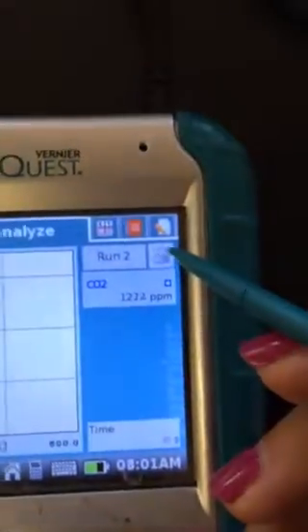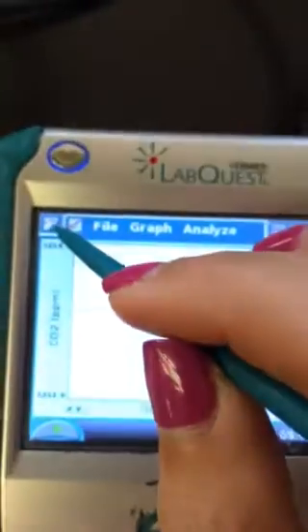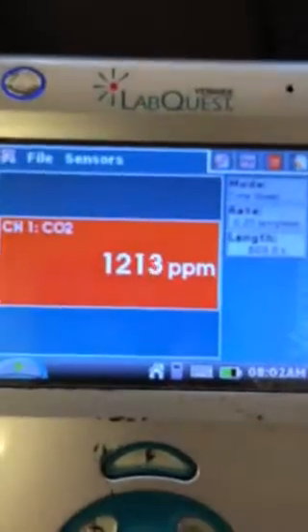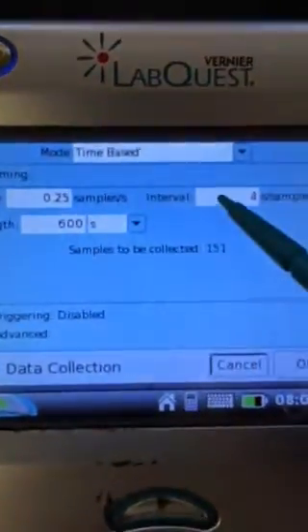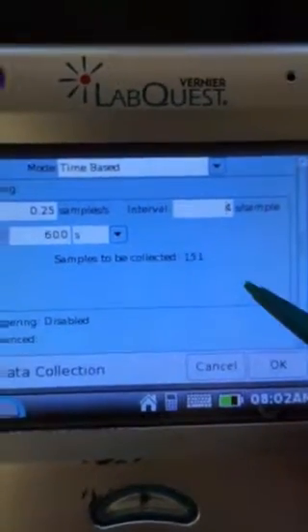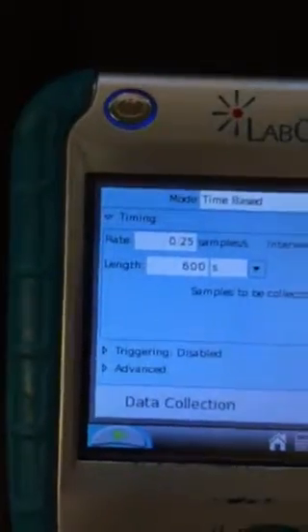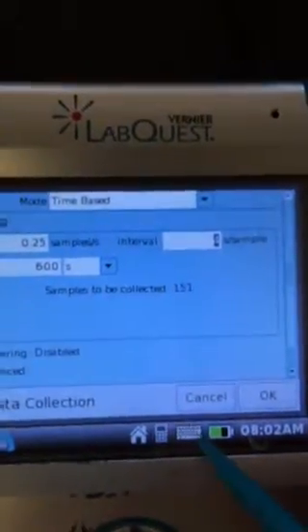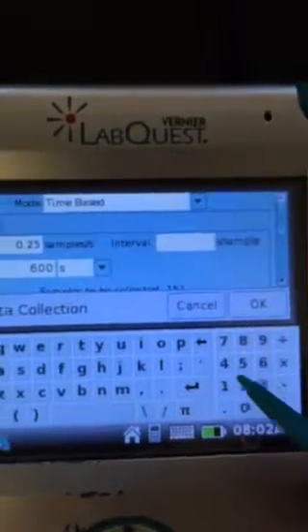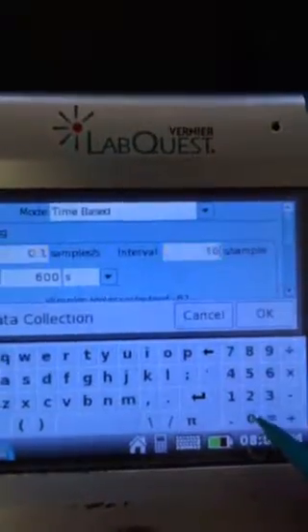So let's delete or just start a new run. I pressed this button to start a brand new run. If we go back to the main screen by hitting the top left corner and click right here, it'll allow us to change those intervals to whatever we want. For example, instead of every 4 seconds for a sample, let's change that. I'll need this little keyboard. I'll delete that. Let's make it every 10 seconds.